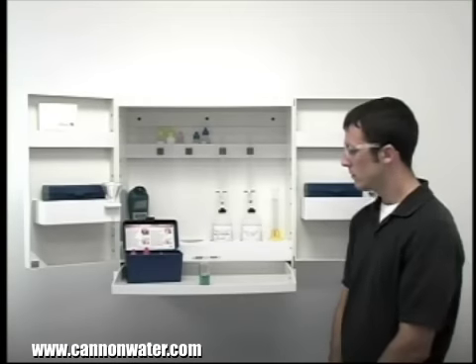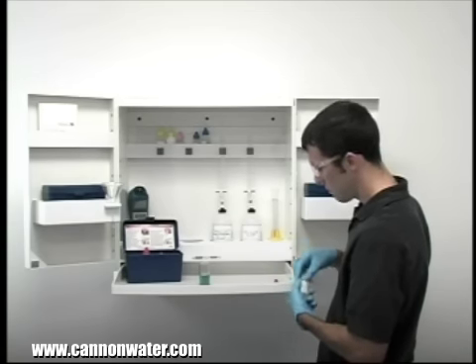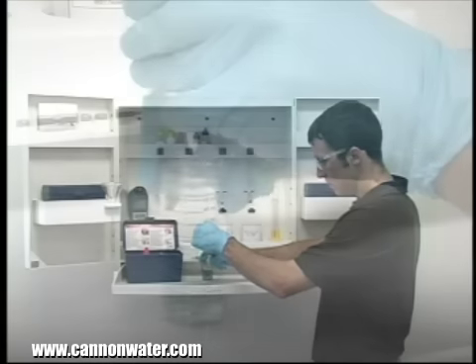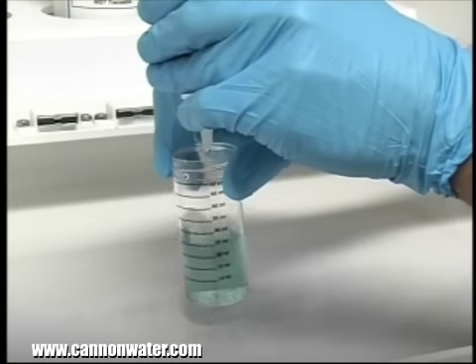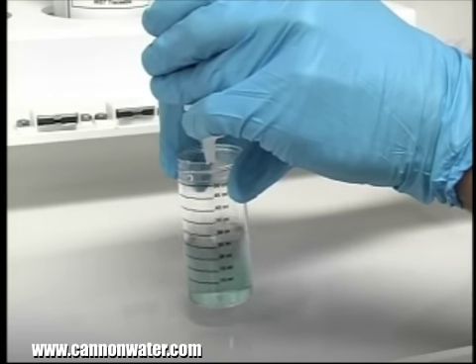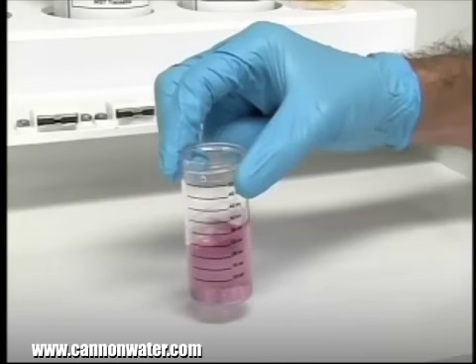The next step according to the endpoint ID procedure is to perform the titration. Each bottle of titrant is labeled with the equivalency and sample size it was manufactured for. It's important to make sure you have the proper titrant and proper sample size for this titration. The bottle of titrant contains a dropper tip, so hold the bottle vertically to get a consistent drop size. After the addition of each drop of titrant, swirl the vial to make sure the sample is properly mixed.